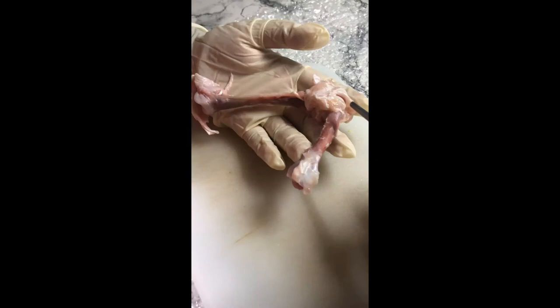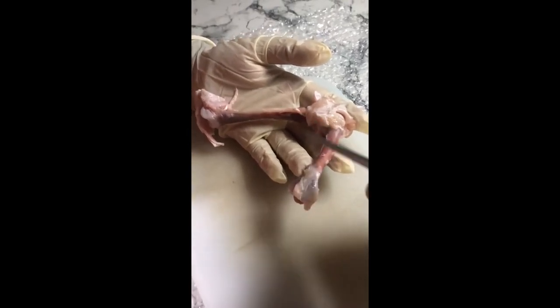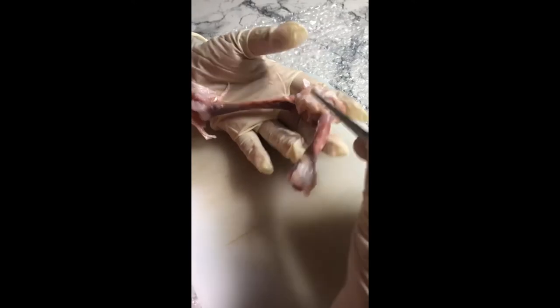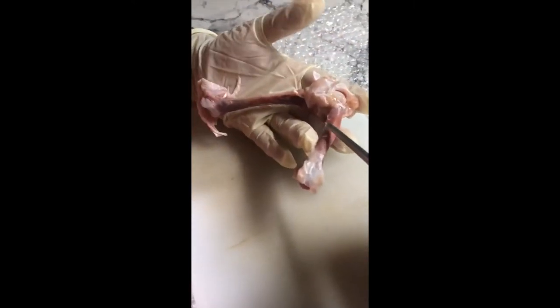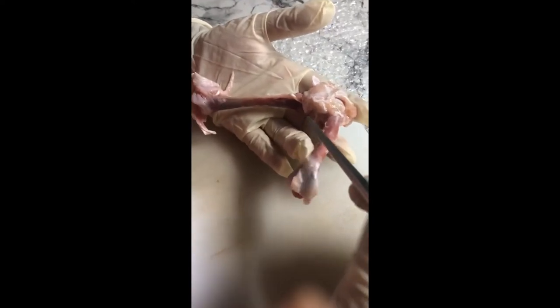The bone you see here is the femur. It connects all the way from your knee joint to your hip joint — it's actually the largest bone in our body. Here, below the knee joint, we see two more bones.